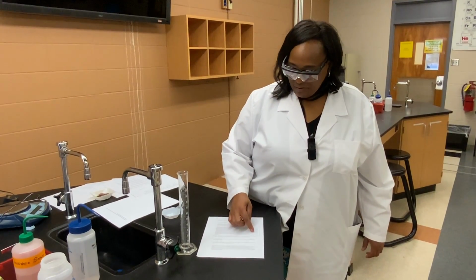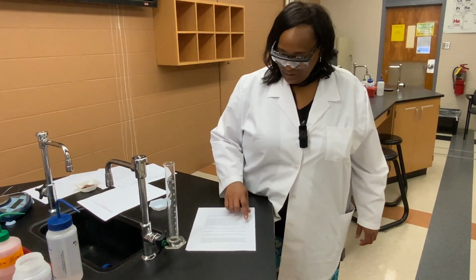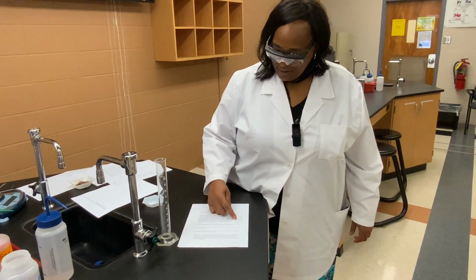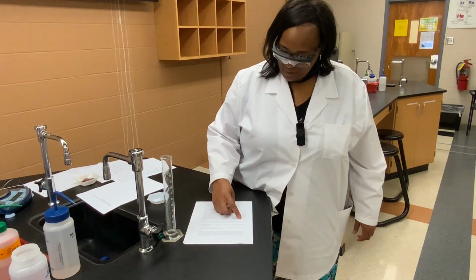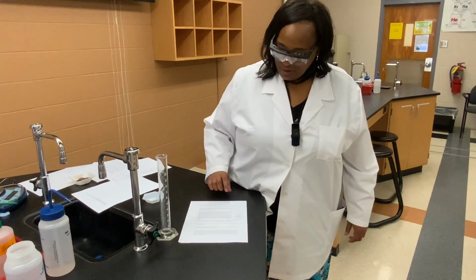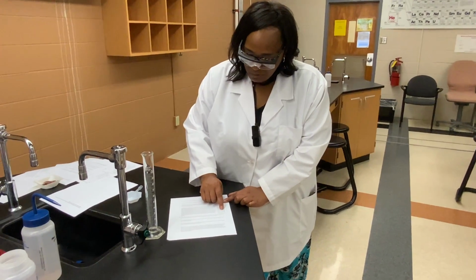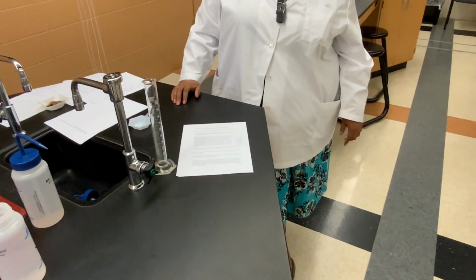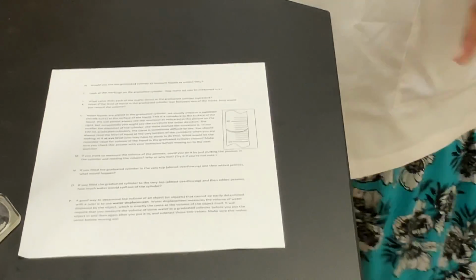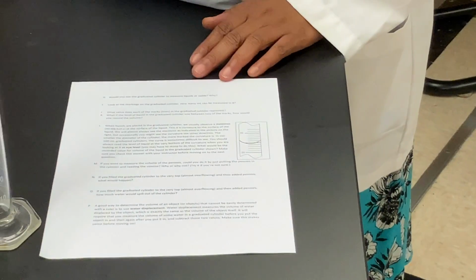And notice how the graduated cylinder picture here is divided into these lines or markings. So this dark line here would be the 25 milliliter mark, because it's right in the middle between the 20 and the 30. So we know that we have less than 25 milliliters because the bottom of this curve is below the 25 milliliter line. So with that in mind, get a good estimate of the volume of the liquid in the picture of the graduated cylinder.